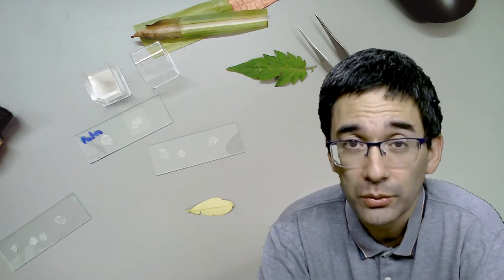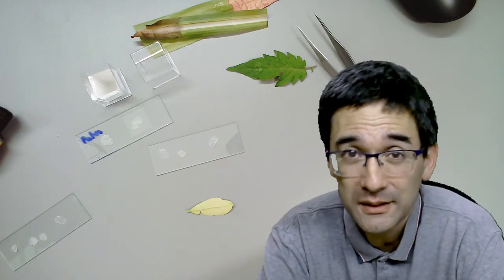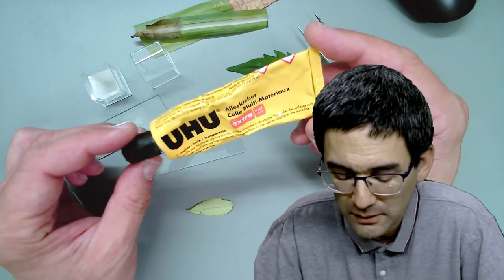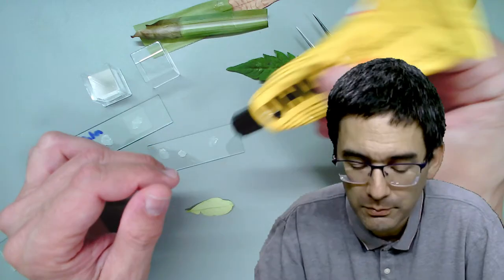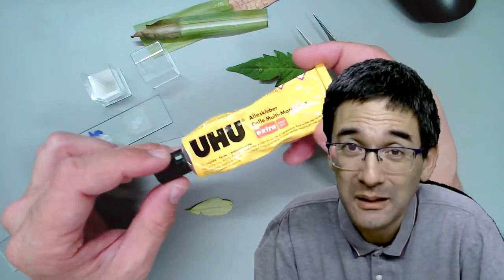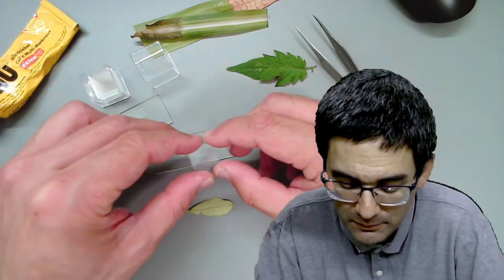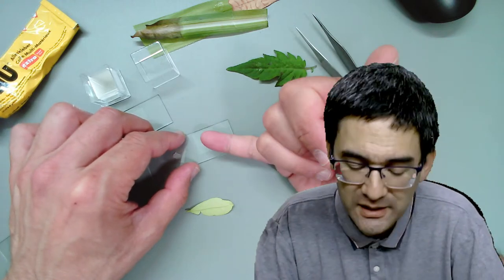Some people have been making their own mounting medium - I tried it myself as well, with limited success. You can also try dissolving this general purpose glue - which might be nitrocellulose, similar to nail polish - in acetone and use that as a mounting medium, but with limited success due to bubbles and clouding. Clear nail polish does work to a limited extent. I suggest using clear or even colored nail polish simply to ring the dry mount - the specimen is surrounded by air and the nail polish simply stabilizes the cover glass.